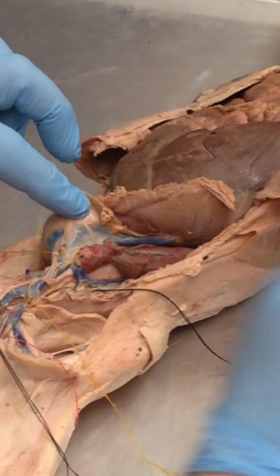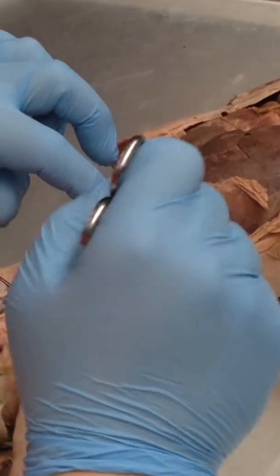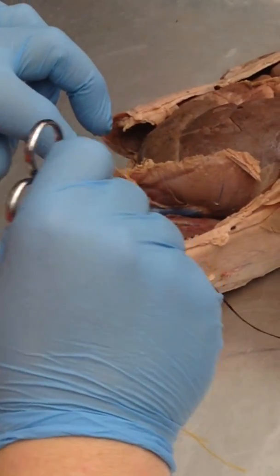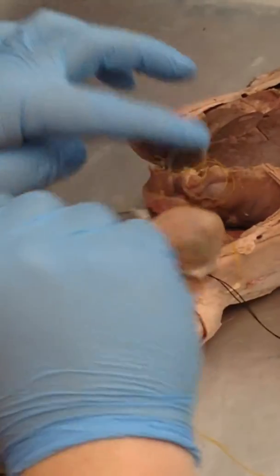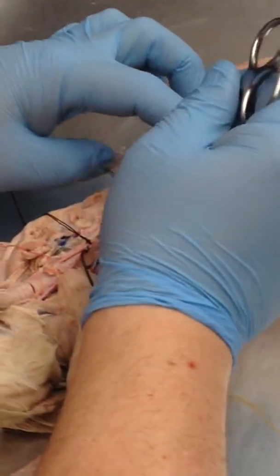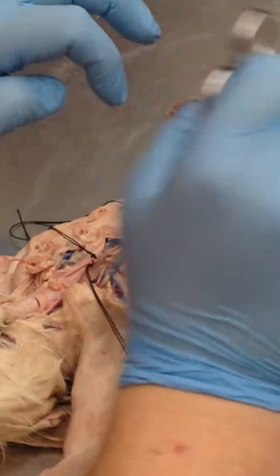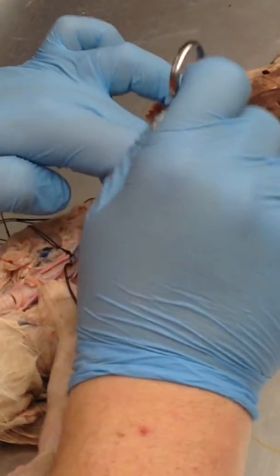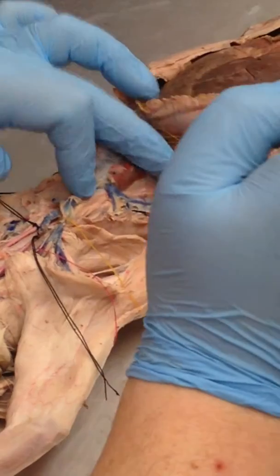All right, it's always going to be running along the ribs. It runs straight up and down, kind of under some connective tissue, a little bit of fat, so it is kind of a challenge to see. But if you're looking at a little white thread up and down the ribs, that's the sympathetic trunk. And again, it is bilateral as well. And yep, I've got it labeled on this side as well with a little black thread here. Again, sometimes you've got to dig it out from under the descending aorta. On this side, I don't know if you guys will hit the veins or not, but it kind of runs right along the azygos vein, the big blue vein that drains the thorax.